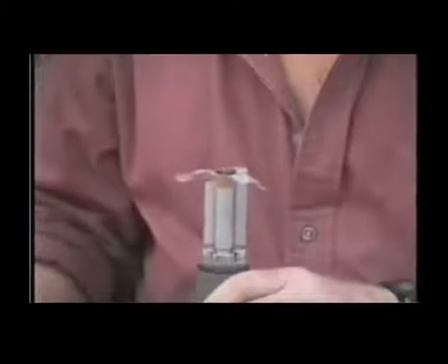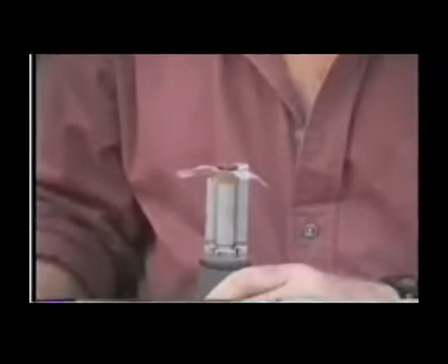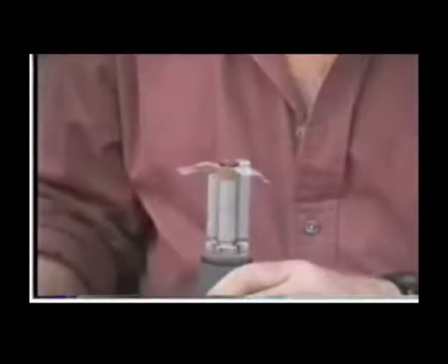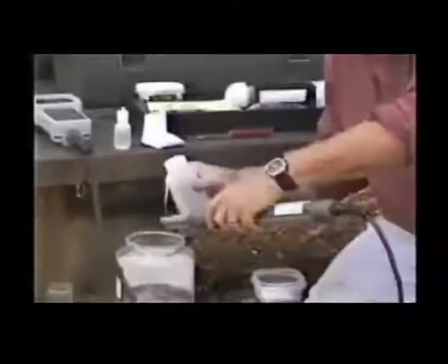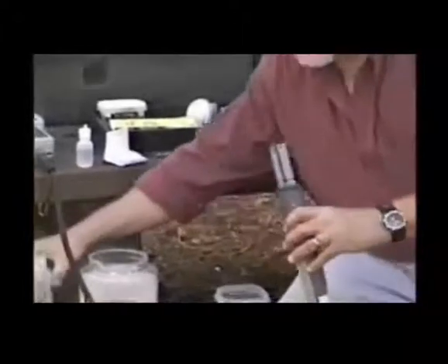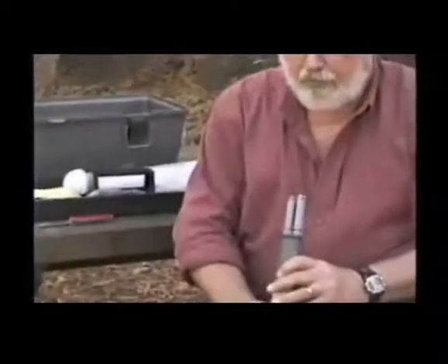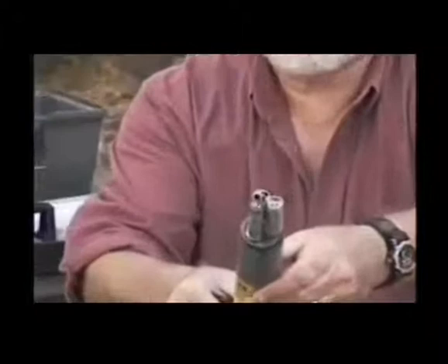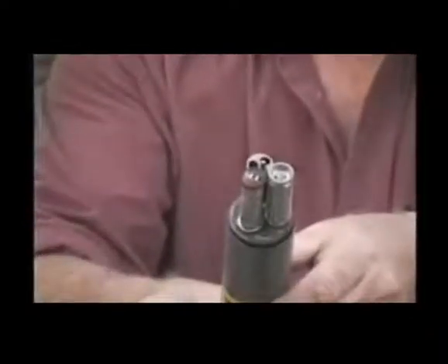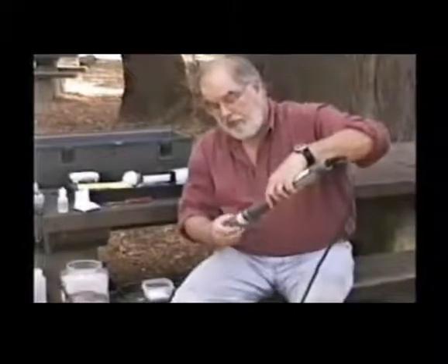The excess membrane material is then trimmed with a pair of scissors or a sharp knife, taking particular care not to damage the probe or probe body. You then want to wash off any extra electrolyte, and we're washing here with just tap water or deionized water. It doesn't really make any difference. And then the final inspection before we put the cap on. Okay, you can see the membrane is tight, no wrinkles, no bubbles, no excess membrane, and we're ready to put the protective cap on the instrument.